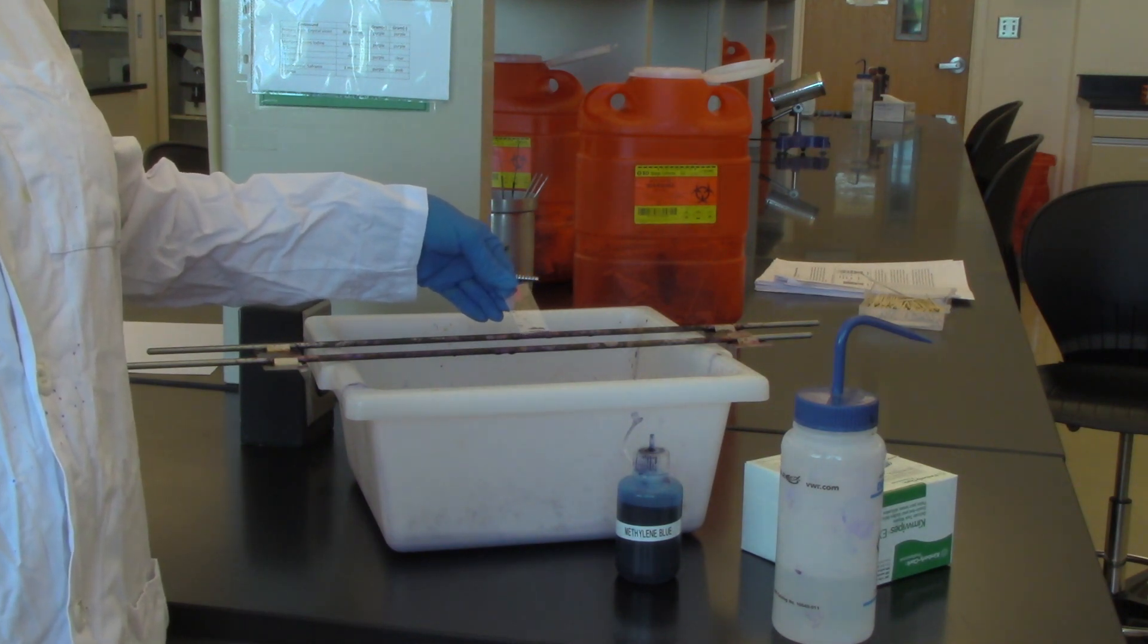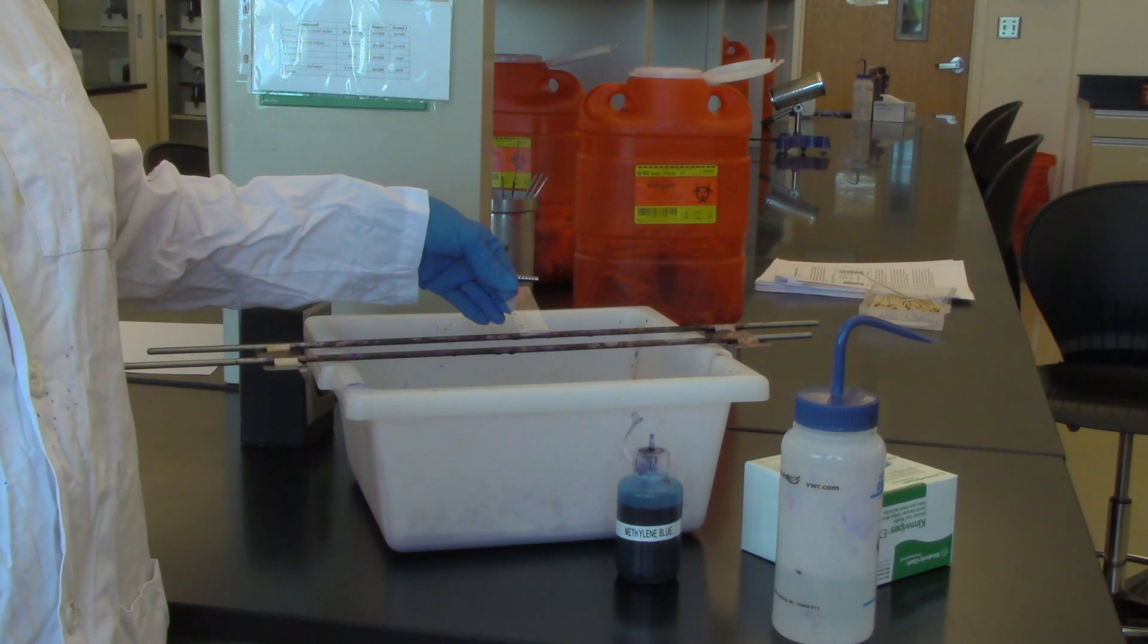You can view this under the microscope now without a cover slip under oil immersion, and that is the simple stain.